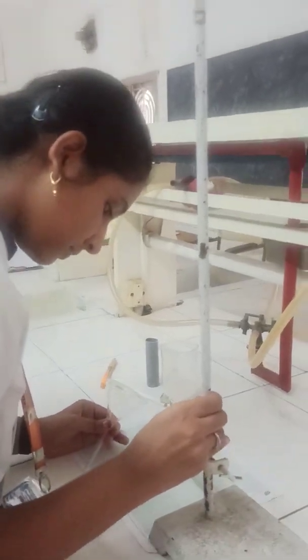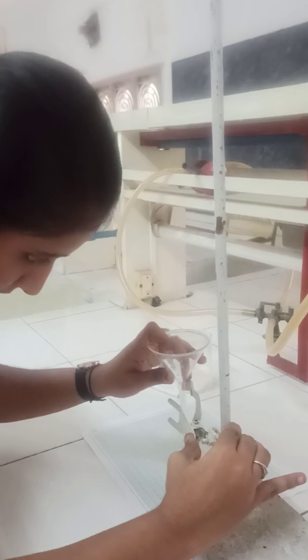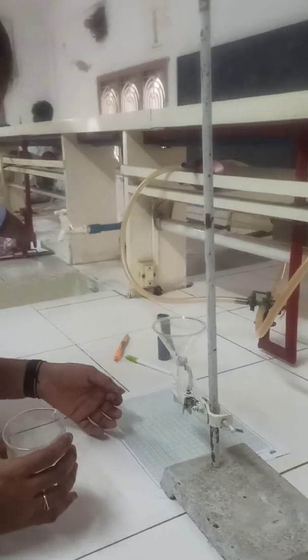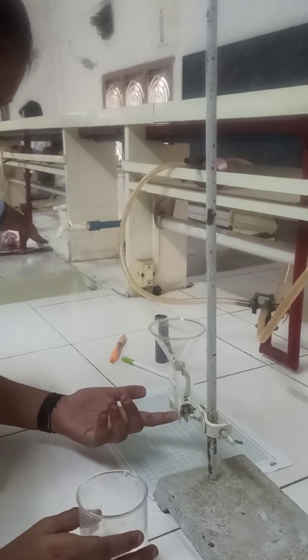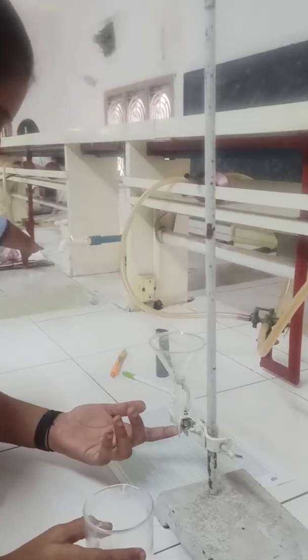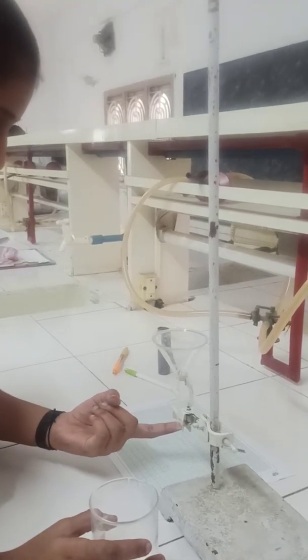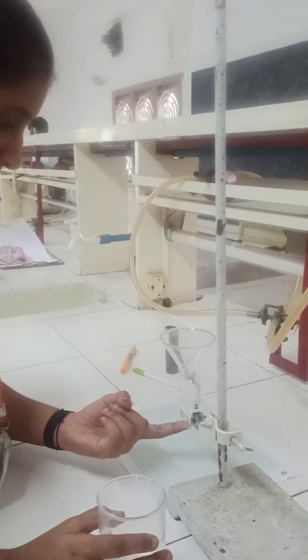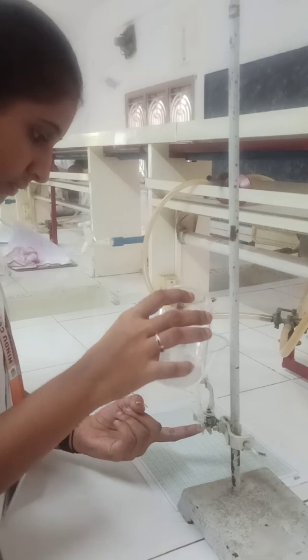First, take the burette stand and arrange it on graph paper. Now fix the funnel. While fixing, we need to take care that the gap between the pile and the bottom of the funnel should be 6.5 mm. To fix that, we need to do 2 or 3 trials to set the funnel at the right height. After fixing the funnel, close the orifice with the thumb and place the sample into the funnel.